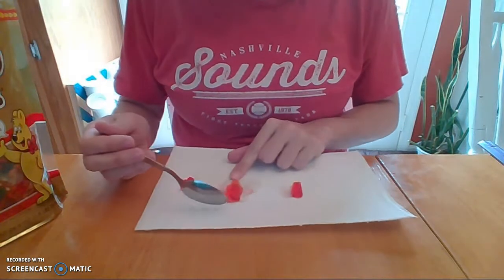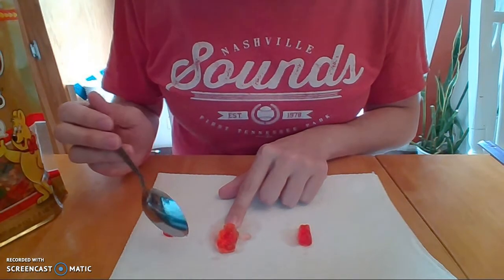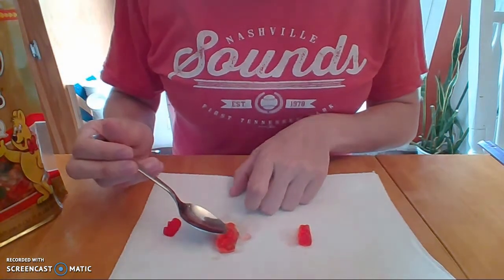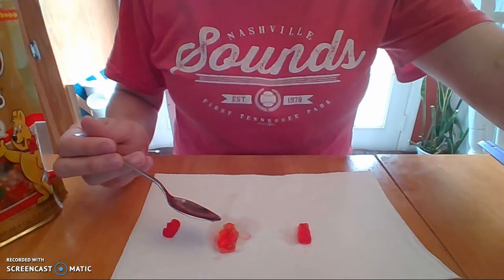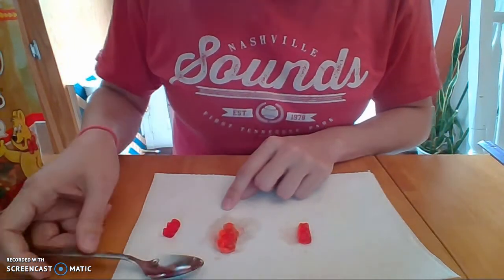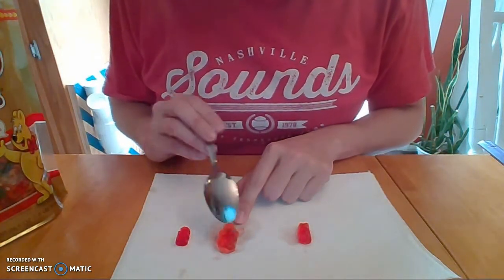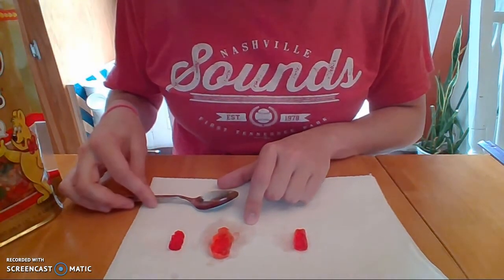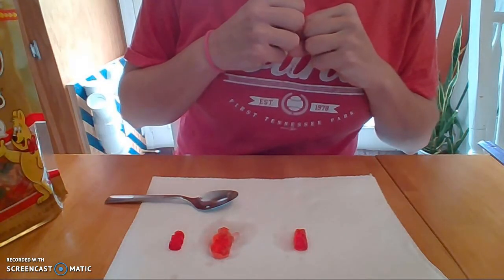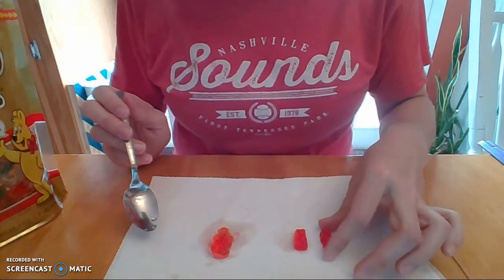So as you can see in the hypotonic solution, definitely our gummy is much larger. He's a little bit more translucent, and he's kind of falling apart here. But yeah, you can see compared to our control, much larger. Definitely in a hypotonic solution, it tended to swell. So let's take our control over here.